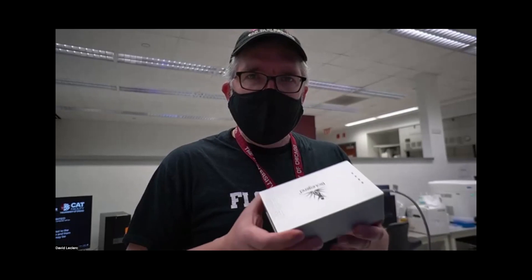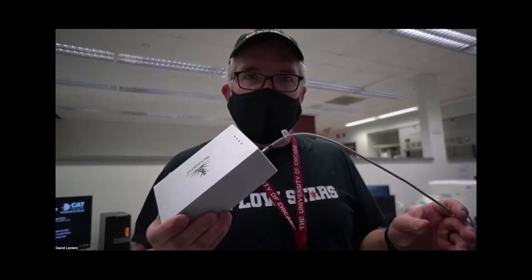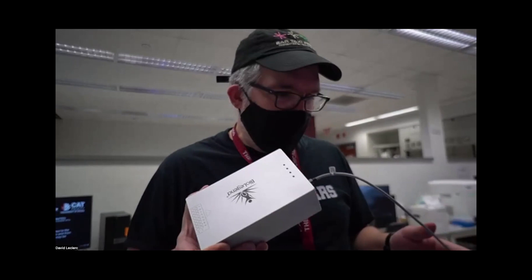The instrument is pretty small, connects to the computer with a USB port, and so it essentially lives in a box most of the time. If you want to use it, it's on the scheduler. We don't really charge for it, so just come in the lab and ask the staff to give it to you. You can use it in our facility or just bring it to your own lab and run it there.